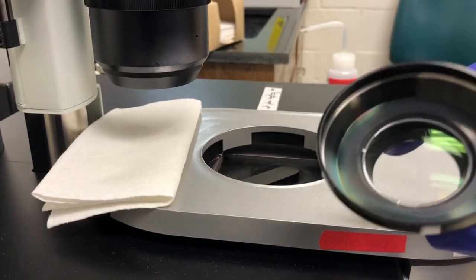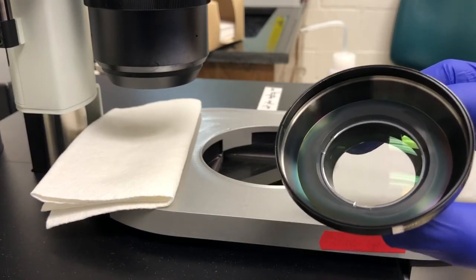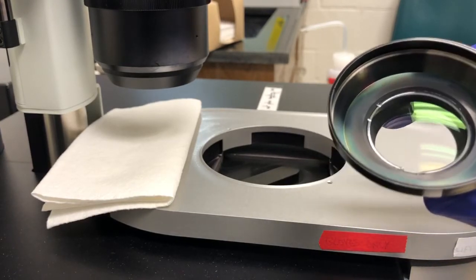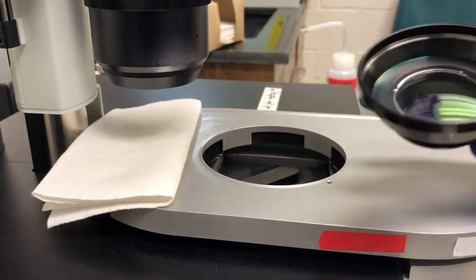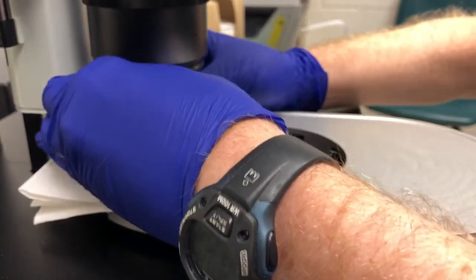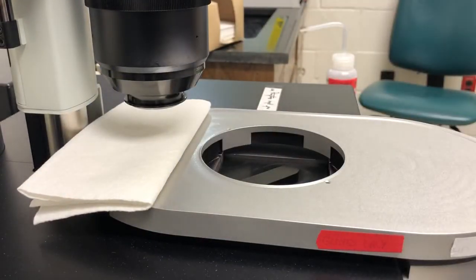Note that these dipping caps come with a ring, and each dipping cap has a particular ring that allows it to fit snugly onto the microscope. So please try and keep each one with its own ring. I'm going to put this back on and discuss other aspects of the weekly maintenance.